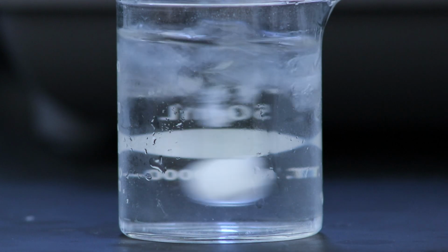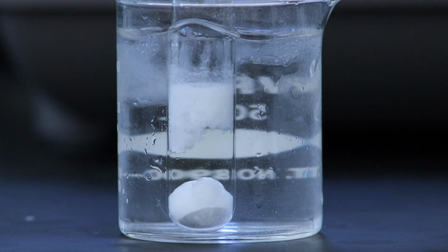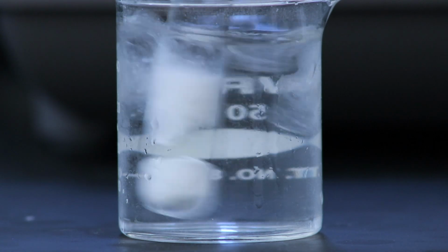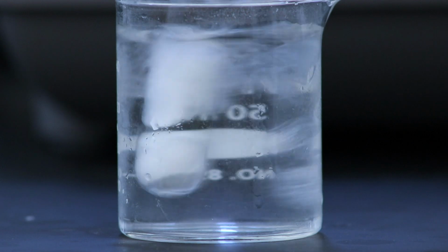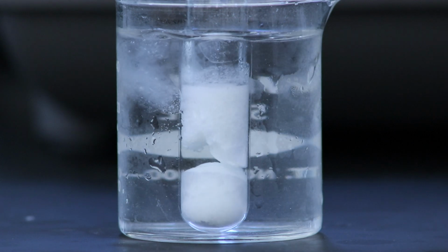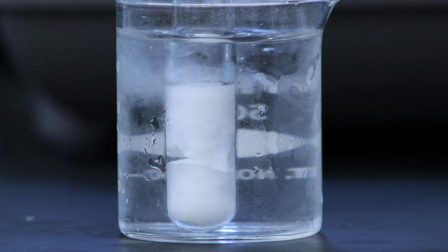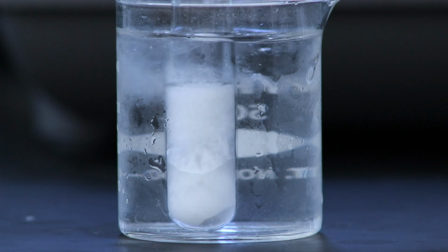Now I've sped the end of this video up a bit, but it took about 2 minutes for the product to fully come out of solution, and if I hadn't stirred it in the ice bath, it's possible that it would have recrystallized slow enough, but I want to try leaving it out at room temperature to see if I can get an even slower recrystallization.